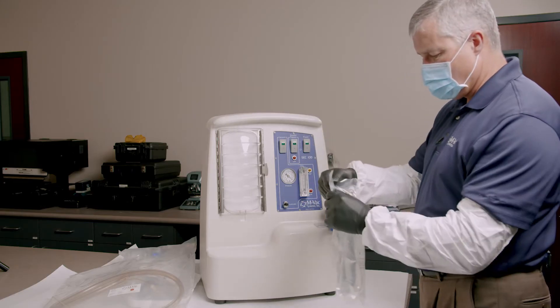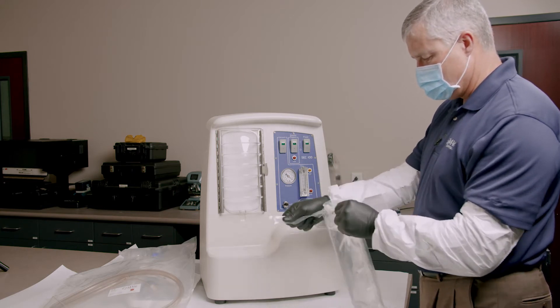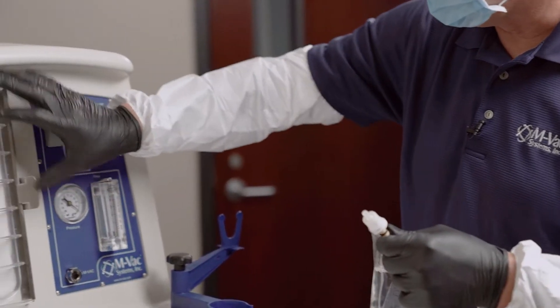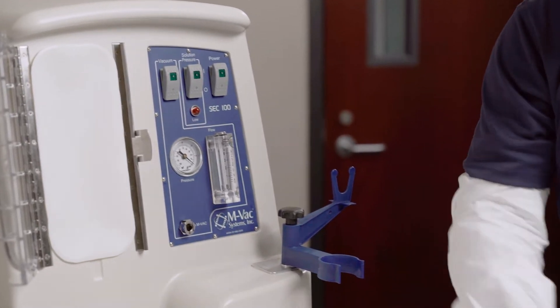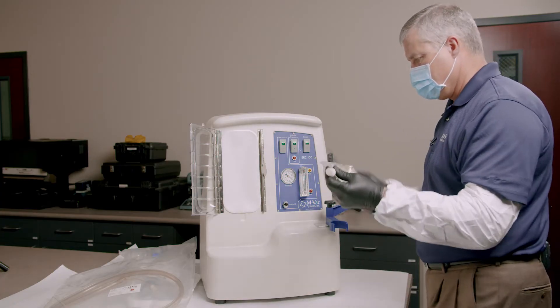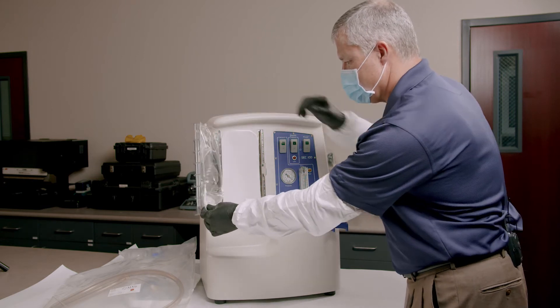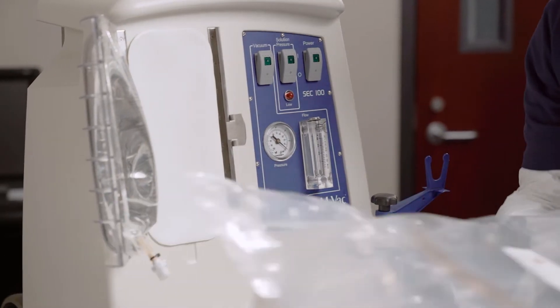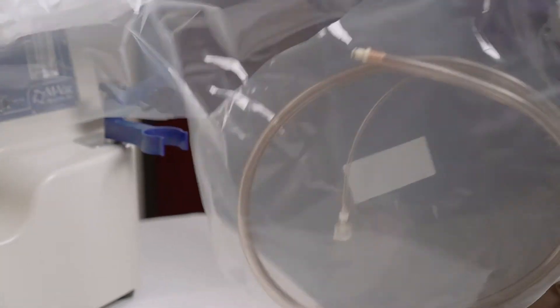The MVAC has some over-wrapping on it, so it's well protected. I'm going to open that up. I'm going to open this door right here and hang the solution bag. If you've ever been in a hospital and had an IV, that's where we got the original idea. I'm going to grab the extension tubing — it also has the same type of over-wrapping on it.